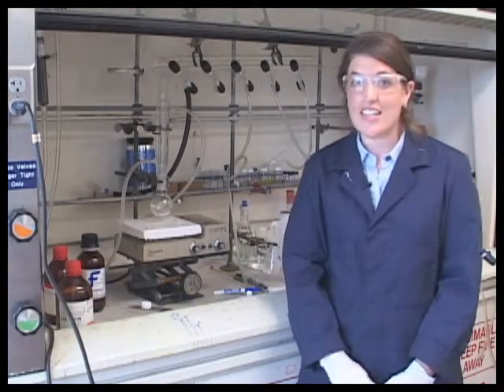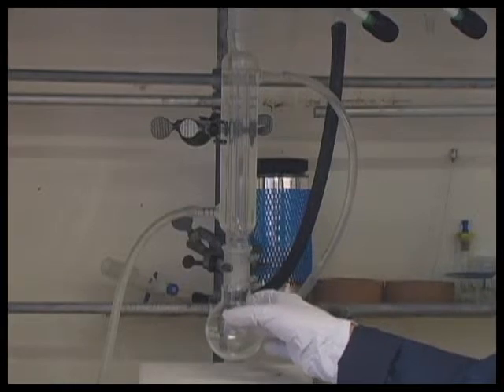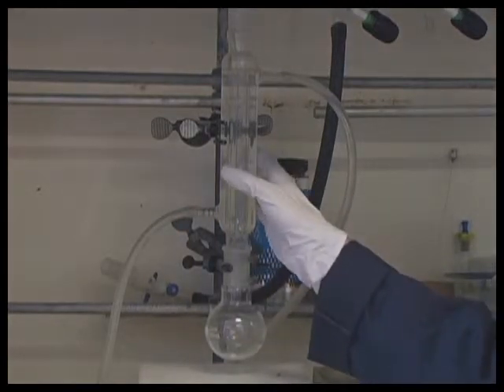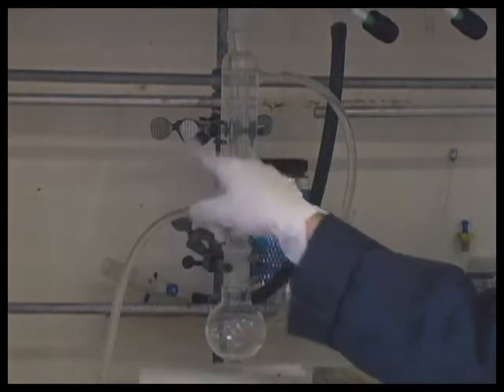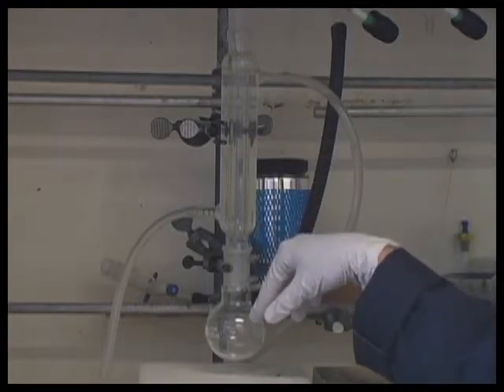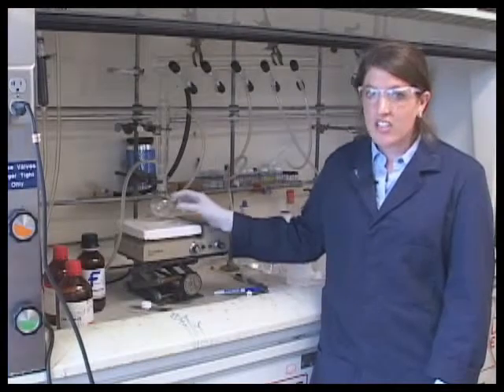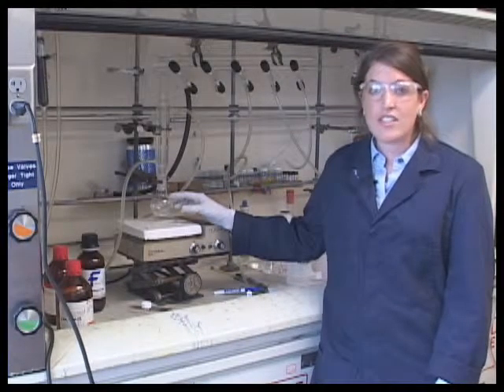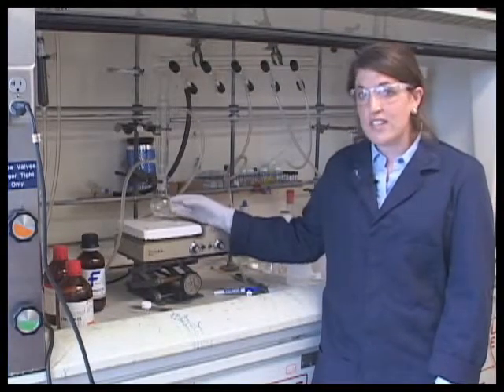In the fume hood, I have set up a typical reaction apparatus. It includes a reaction flask and a reflux condenser. The reflux condenser has water circulating, which condenses any vapors and forces them to fall back into the reaction flask. Many reactions are heated in organic chemistry, but this reaction is exothermic, so I don't need to heat it.